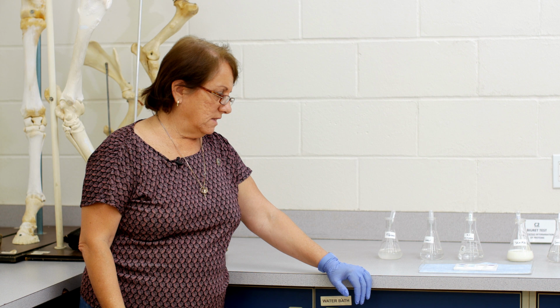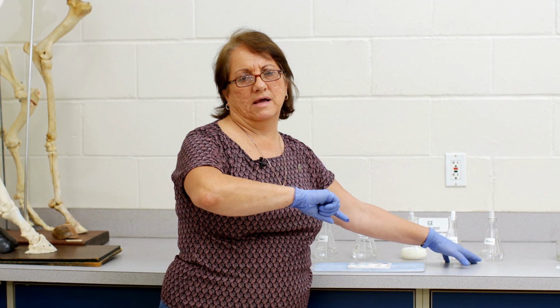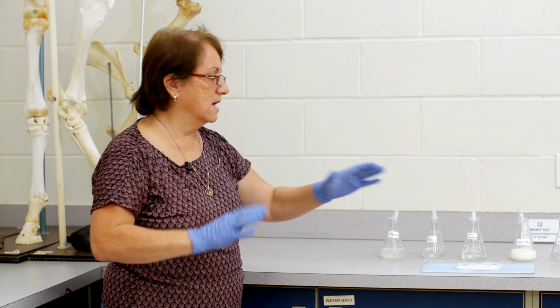Now, interestingly, these two amino acids, even though proteins are made up of amino acids, Biuret's doesn't test for free amino acids. It only tests for amino acids bound in a peptide bond. So despite the fact that proteins consist of amino acids, free amino acids will not be picked up on this test because it doesn't test for that.